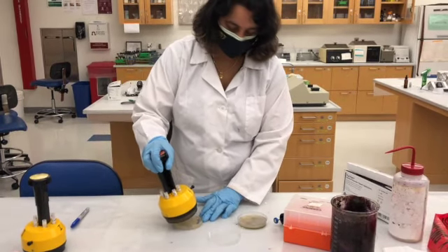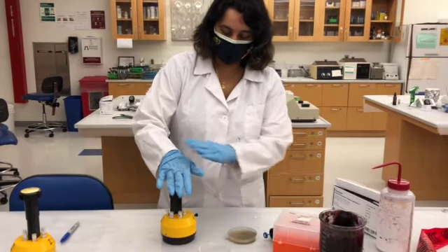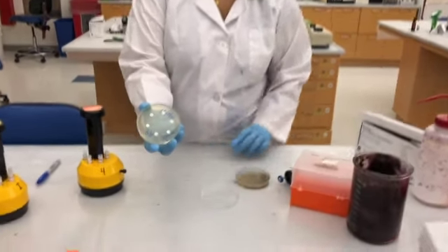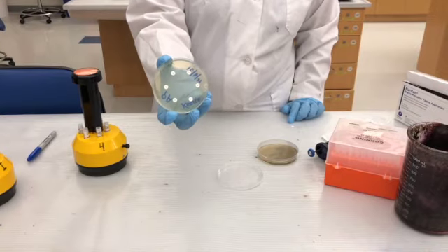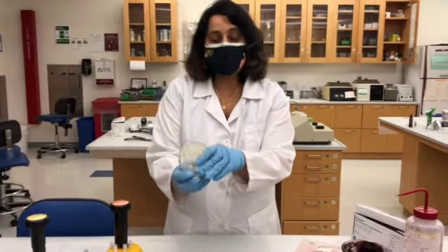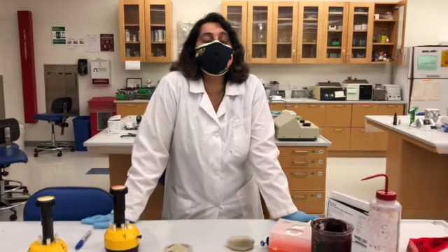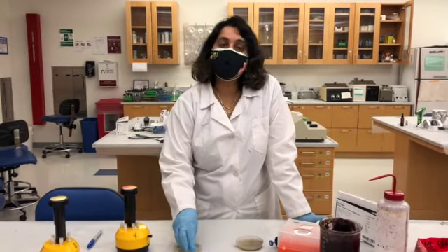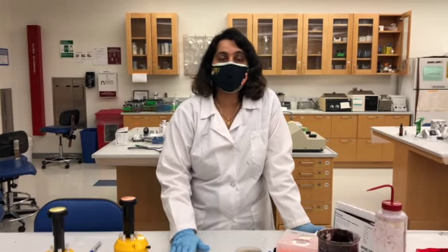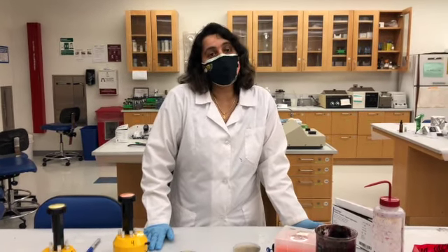Open the lid. Make sure the dispenser sits right on the plate and press it once. There you go. So you can clearly see there are 6 different antibiotics, and those antibiotics are on those filter discs, and that antibiotic would diffuse. So that's the reason the name of the technique is Kirby-Bauer disc diffusion method. The antibiotics would diffuse into the media, and when the bacteria grow in 24 to 48 hours, those antibiotics would start acting on the bacteria. So if the bacteria is resistant, it won't care, it would still grow.